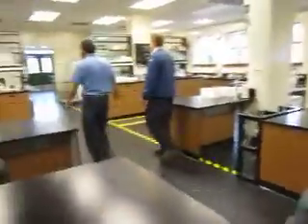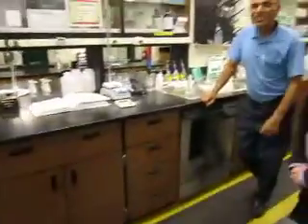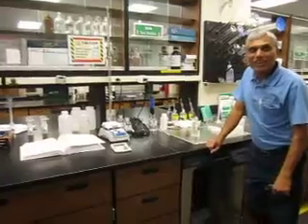Okay, come over here. Yeah, that looks like our classroom. Okay, this is where I do my Winkler test.